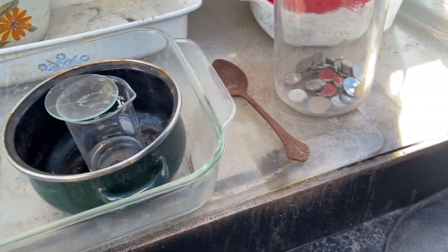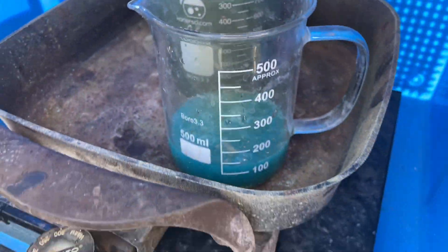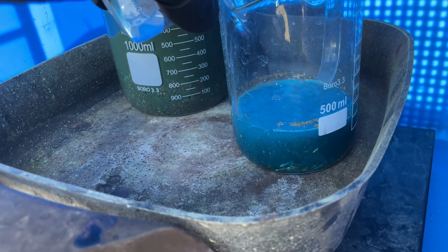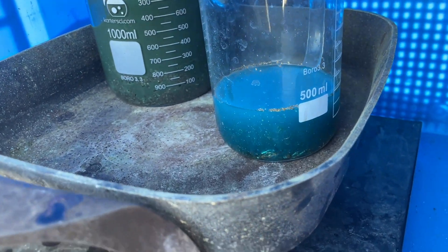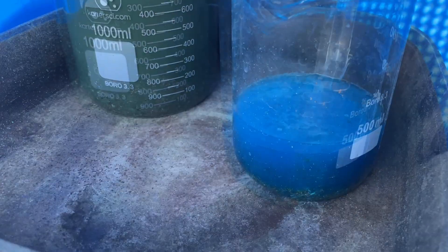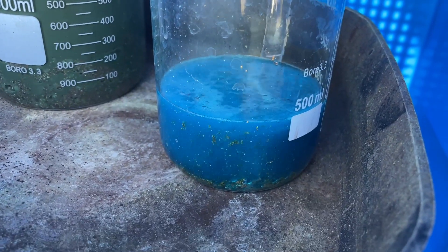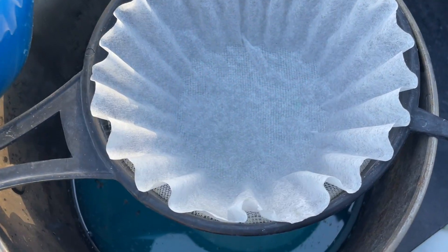Get that last little bit — she's cooking now. Let me get the lid on. I thought I'd add a little bit of water because last time it looked like the copper got too thick, so I'm going to add 50 more mL. We're up to about 120 mL of nitric acid used burning up these pins so far.